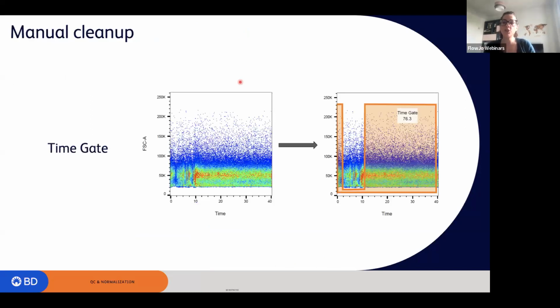Once we check the quality of the samples using the default tool within FlowJo, we still need to clean up manually on time. If there are alterations, what we get is a warning. FlowJo will not clean up our data automatically, but will give us a warning, for example in the red case, a very high number of flow alterations during the acquisition. In that case, we need to go manually, and we can start by plotting a physical parameter versus time. As you see in this example, there are alterations right here.